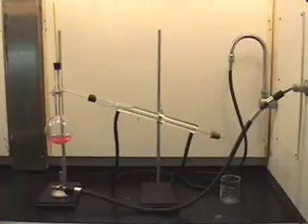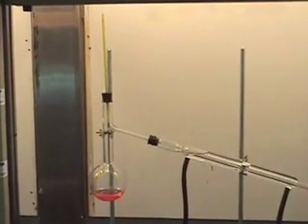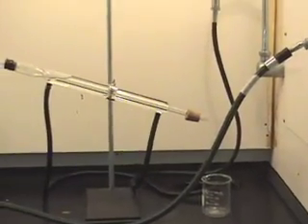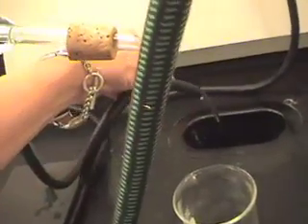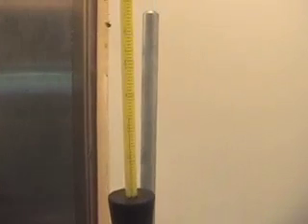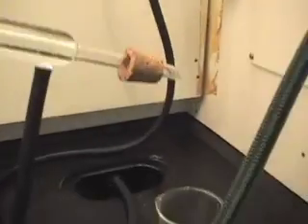Now I'm going to physically separate these in a distillation apparatus. I've got a side-arm flask with a thermometer in it. That's called a condenser — it has water flowing through it, coming up the bottom and out the top, and you can see it coming out at the end of this hose. That water is a coolant and it will condense or convert the vapors back into a liquid. I'm heating this and the thermometer reads only 35 degrees Celsius, and right now there's no liquid coming off, so very little is in the vapor phase.